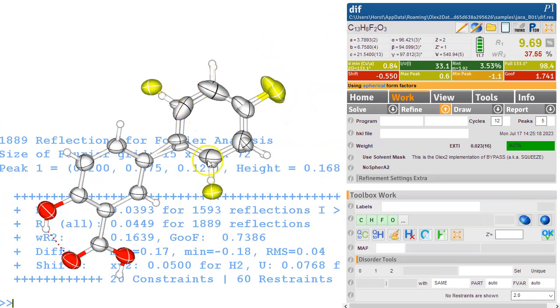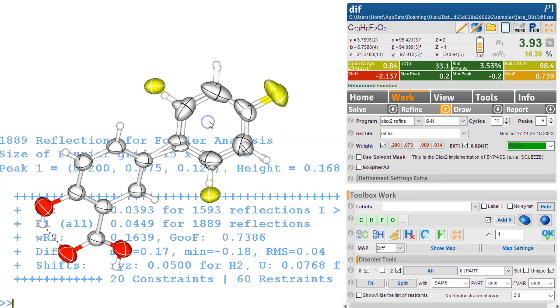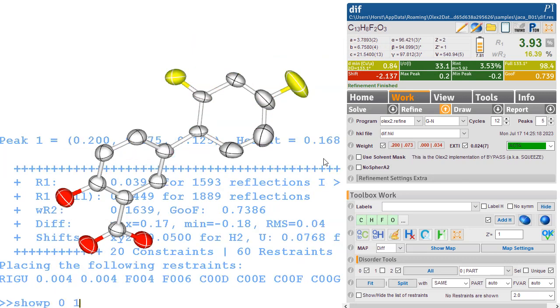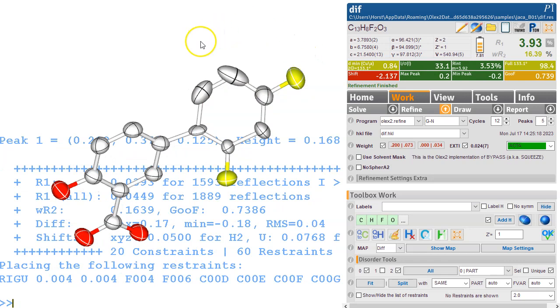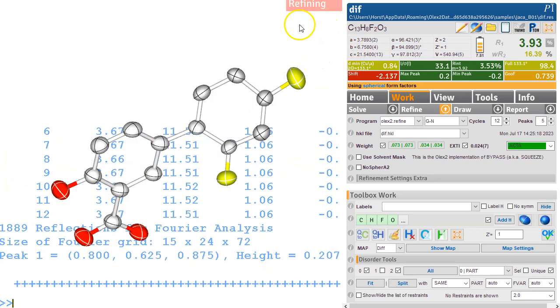And now the ADPs are of course causing correlation because we're refining two objects which are very close in space. So the way to deal with this is to press Control H, so that hides the hydrogen atoms. Look at just show PART 0 and 1, select that disordered part and type RIGU, put the RIGU restraint on that, and then 0 and 2, and do exactly the same here. Just put a RIGU on that, and hopefully the RIGU is going to pull this right.